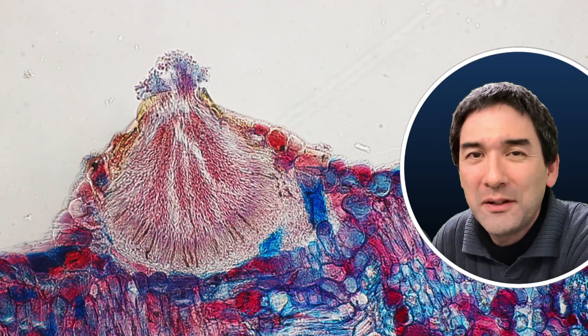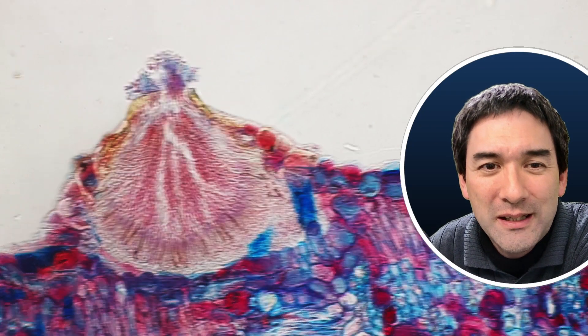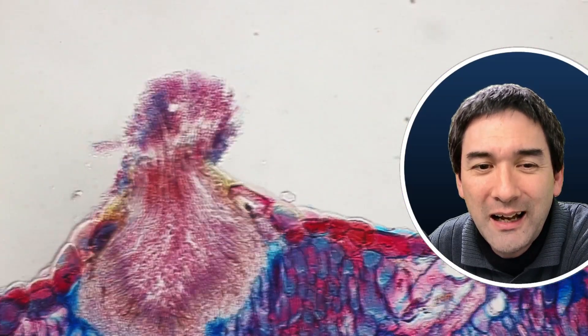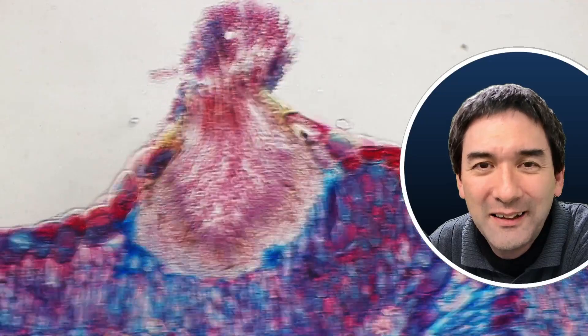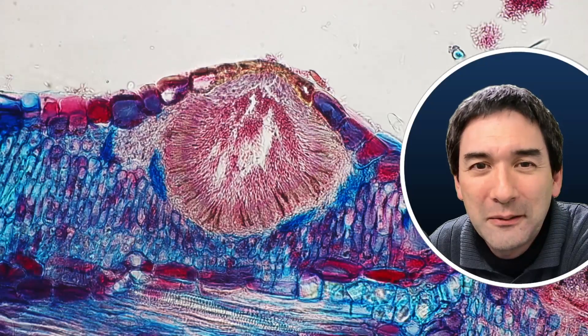And there is, as a matter of fact, also a second one somewhere. Not here — it's on the other side. Here's another one. And as a matter of fact, here on the far left side, this one did not erupt yet.